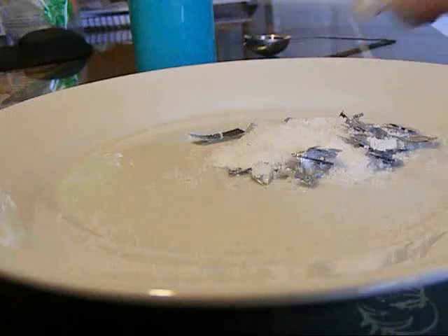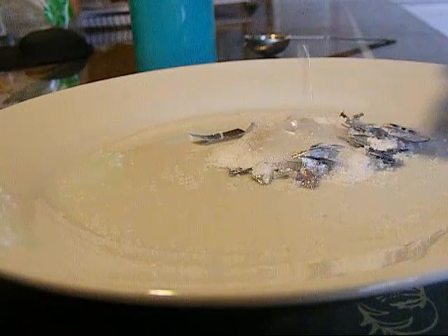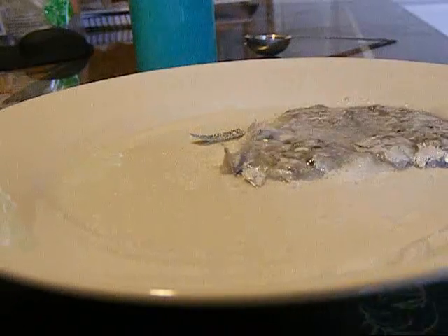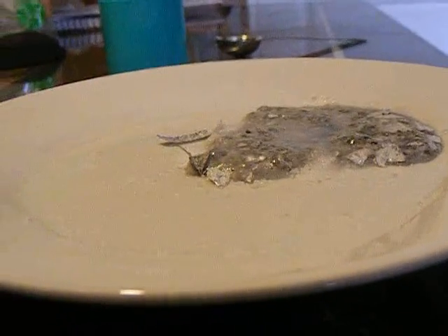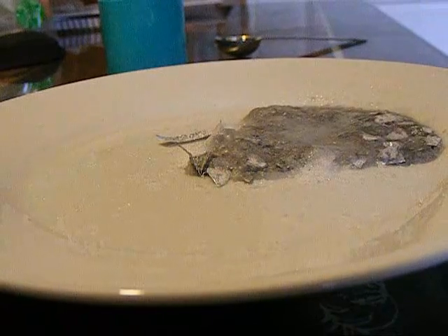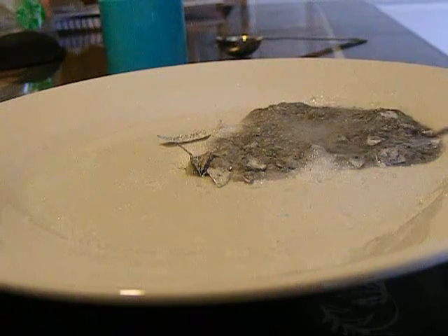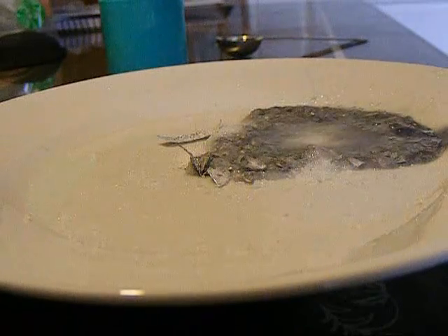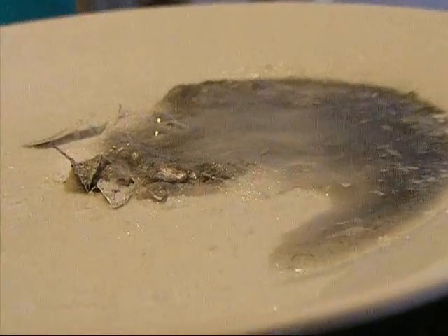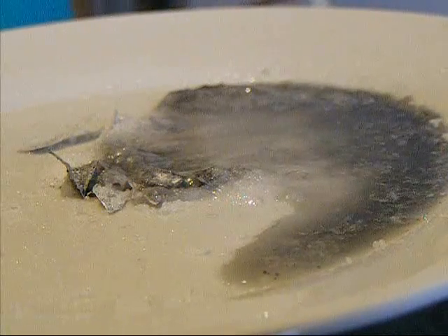Sodium Hydroxide is very reactive. Now, this is simply water. One of the chemicals given off here is Hydrogen. You can see it's very flammable, and this is melted — all of the Aluminium foil completely. That's a tablespoon of Sodium Hydroxide with 5 mL of plain water from the tap.